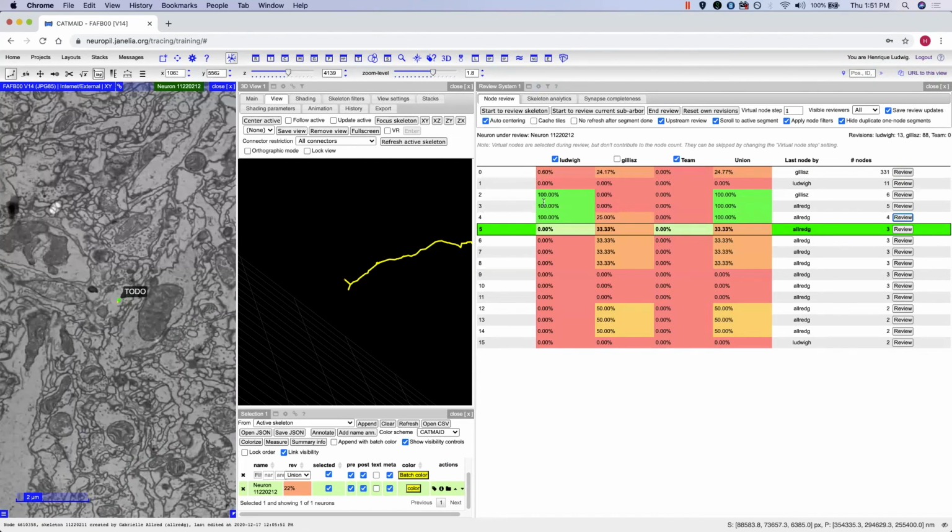When you've completed reviewing all of the segments in your neuron, go ahead and press End Review.